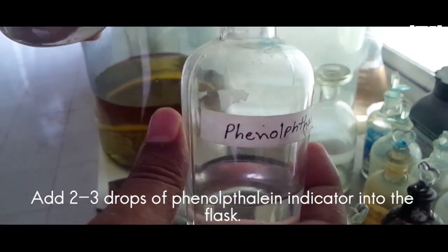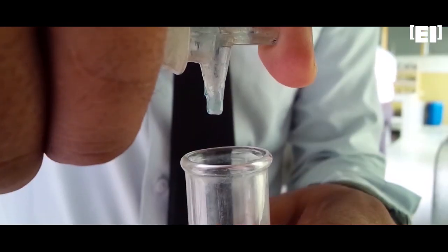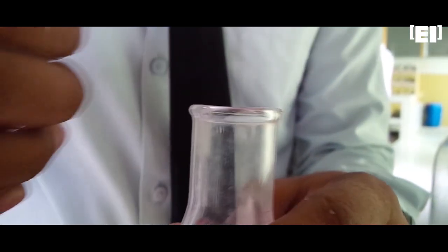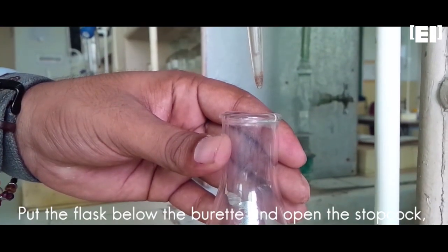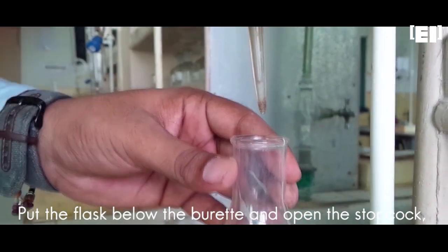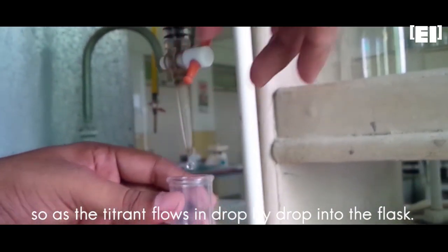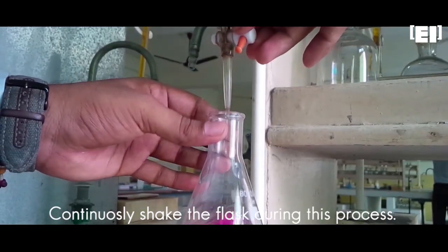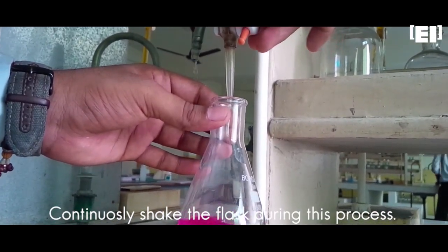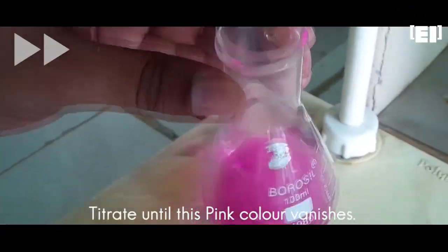Add 2-3 drops of phenolphthalein indicator. This gives pink color to the solution. Now put the flask below the burette and open the stopcock, so as the HCl flows in drop by drop. Continuously shake the flask during this process to let the drops mix with the solution completely. Titrate until the pink color vanishes.